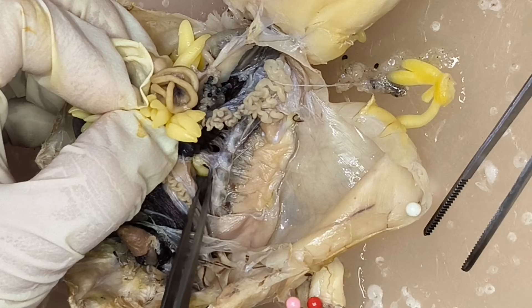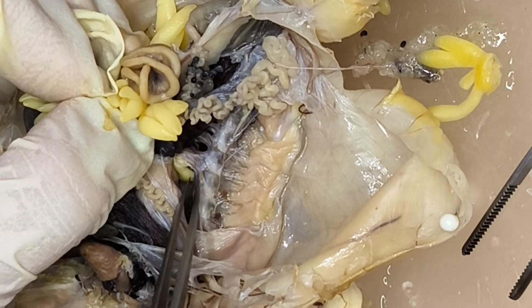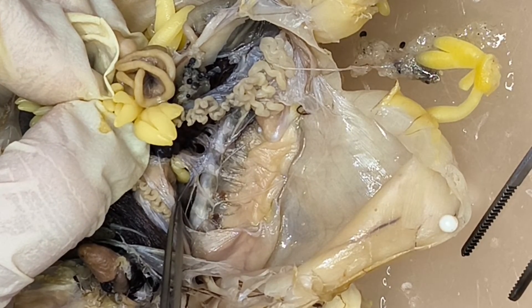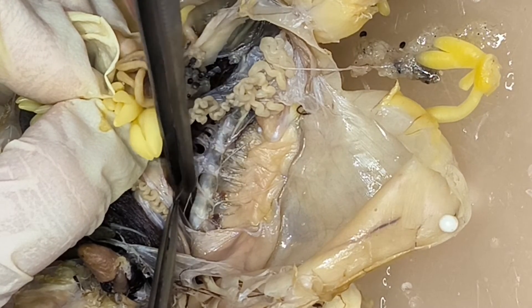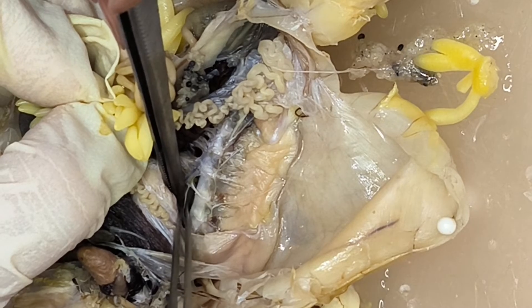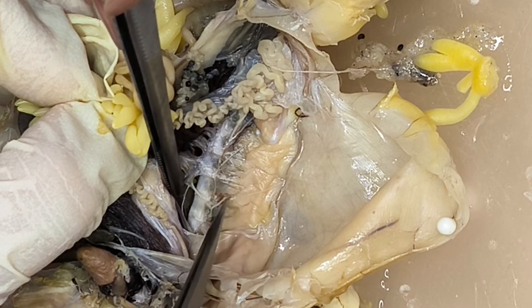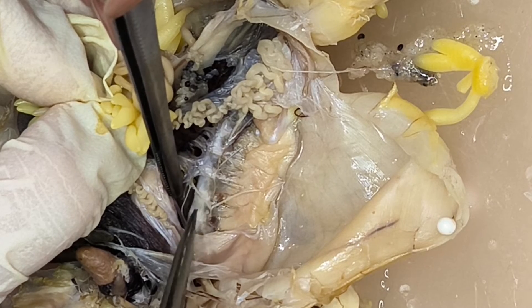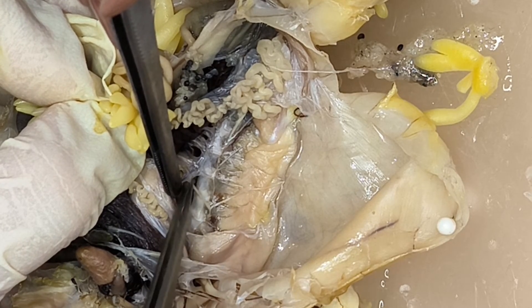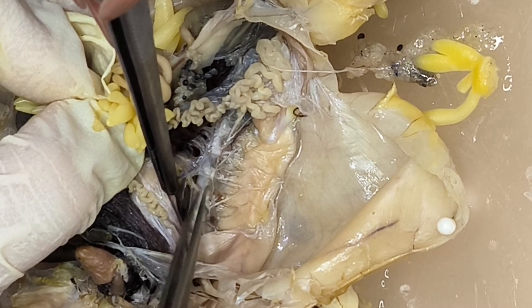So in this area, that is where the ganglion is. This is part of the sympathetic trunk — running straight. The sympathetic trunk is a chain of ganglia. If this is the fourth spinal nerve, it is connected to the sympathetic trunk via the ramus communicans, and where they communicate is where you see the ganglion — although it's not very noticeable here because the specimen is very small.